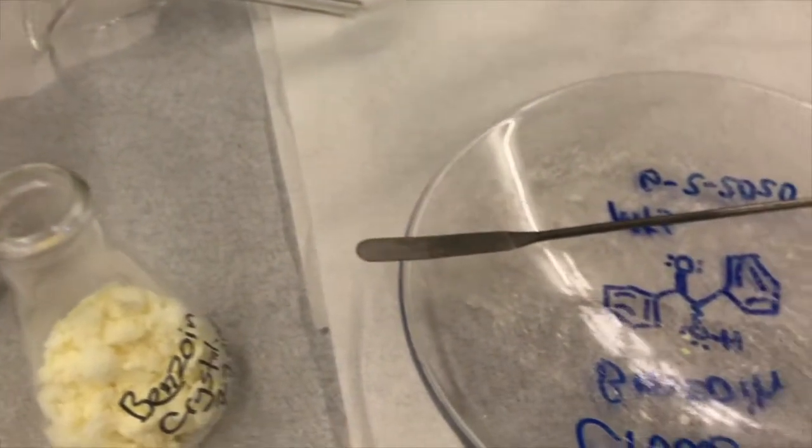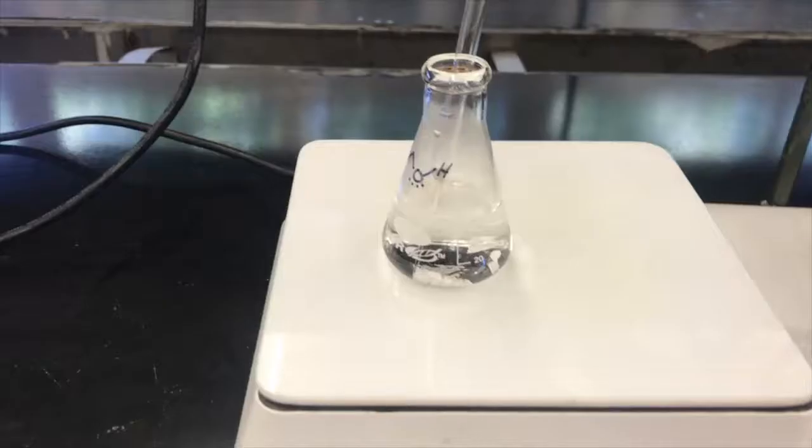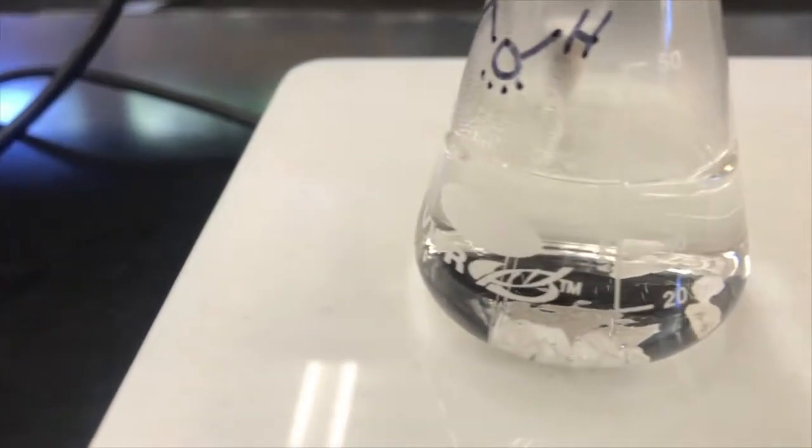And the first amount of ethanol I add, I'll actually add to my watch glass to get this last little residual, which then I'll put into here, which you'll see shortly. I'm just waiting for my ethanol to continue to heat up. Let's see where it's at now. Seeing more bubbles yet? Okay, my ethanol is just starting to boil a little bit.